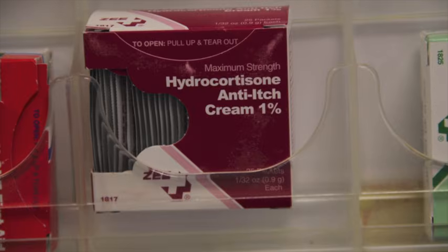Also, when wearing latex gloves, if your hand becomes itchy and burning, it is likely you are allergic to latex. Take off the gloves and wash your hands. In the first aid kit we have hydrocortisone pads to wipe the affected skin, which should help reduce symptoms. Please be mindful of the scalpel as it is very sharp and can slice through the skin easily.